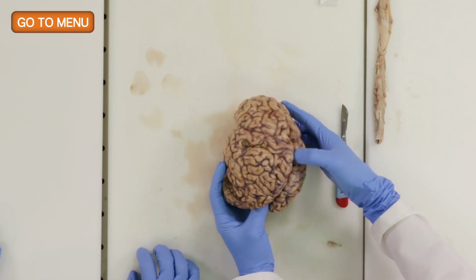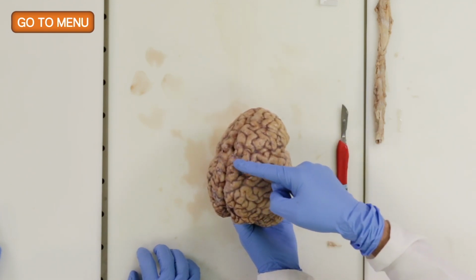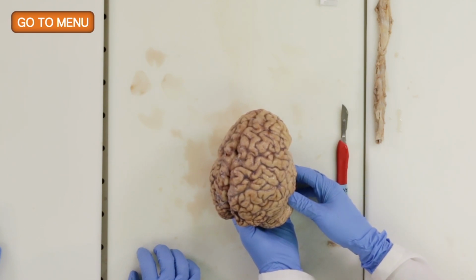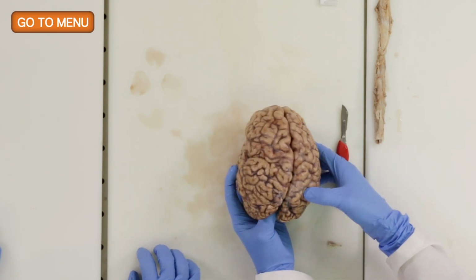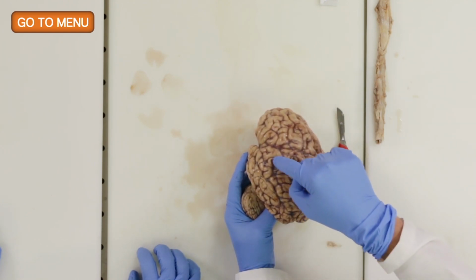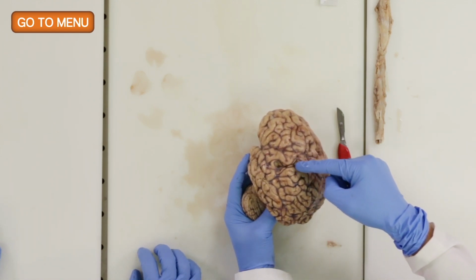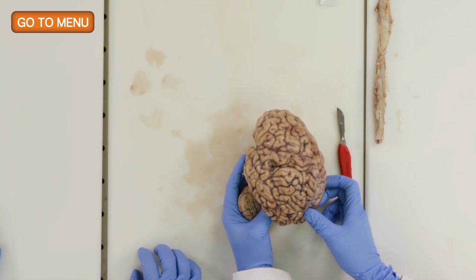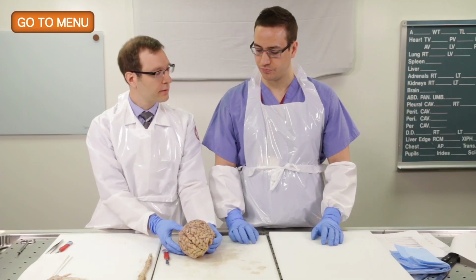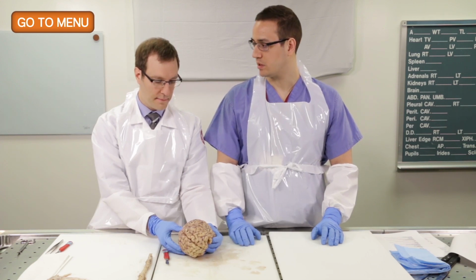That's right. So if we compare to this side, for example, where we don't see the lesion, we see a nice central sulcus with the motor strip and the somatosensory strip. If we come to this side, in contrast, we can see a cystic cavitation right here. And it looks like some of this atrophy and/or gliosis, which we may see, extends along the motor strip. So does this correspond, do you think, with her clinical symptoms? Yeah, absolutely. I think this could explain the right-sided weakness that she was having.